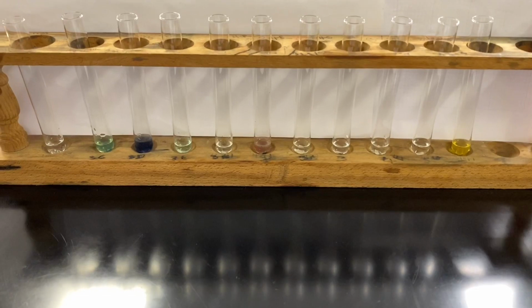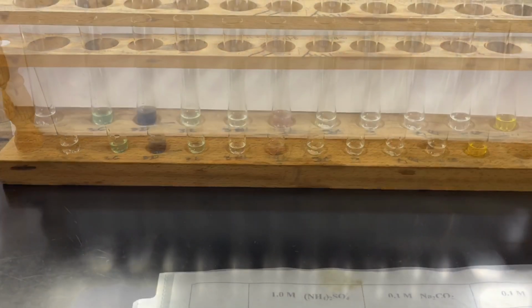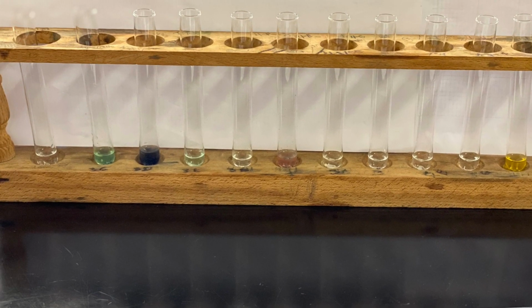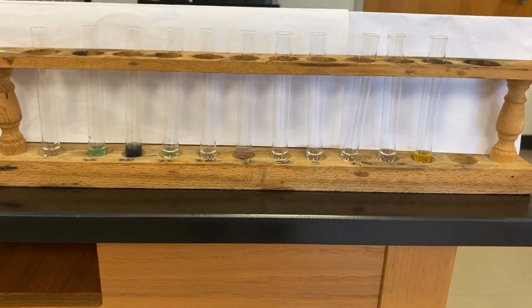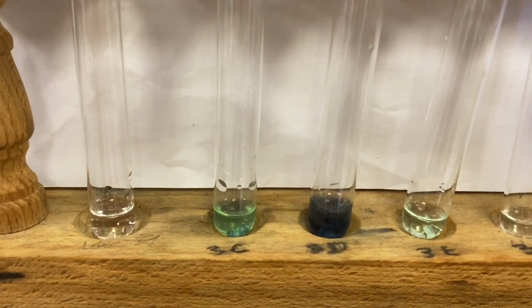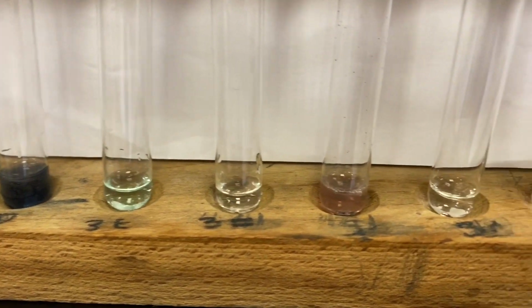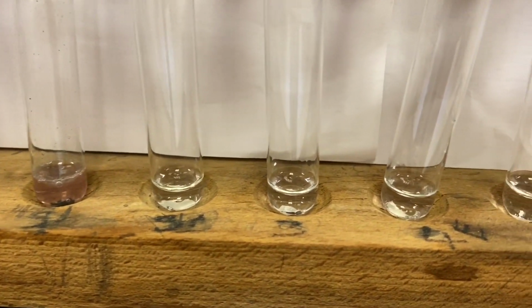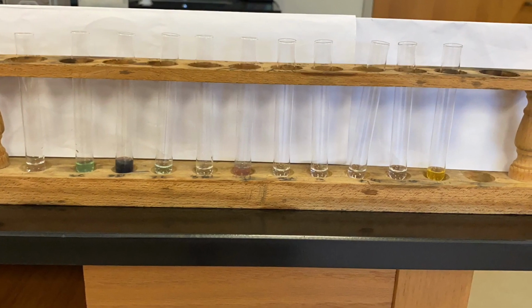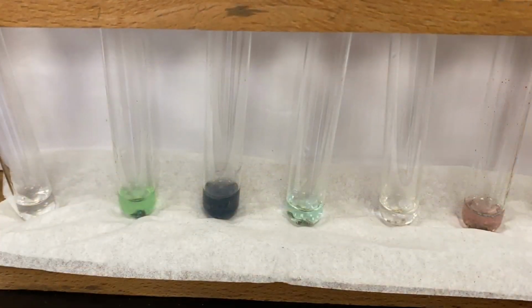During the mixing of two different chemicals, you have to observe the three visual indicators of a chemical reaction: change in color, formation of precipitate, and or formation of effervescence. For page 48, you will just record if there was a reaction or no reaction between magnesium and the metal cation solution.